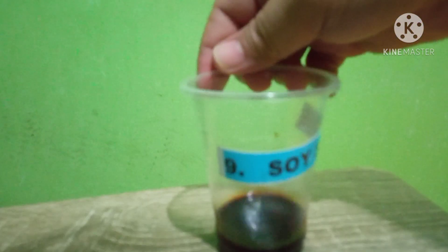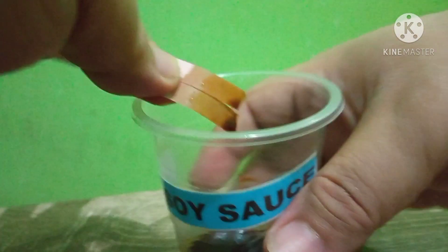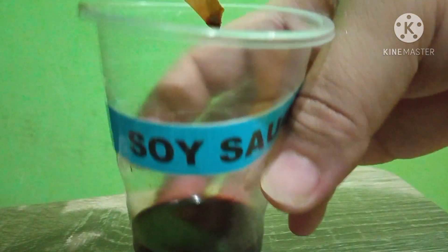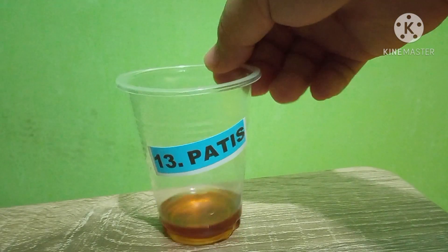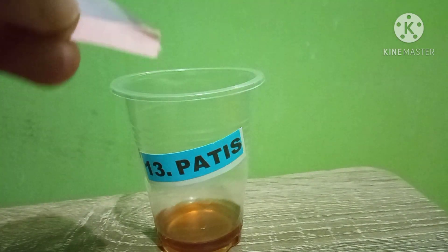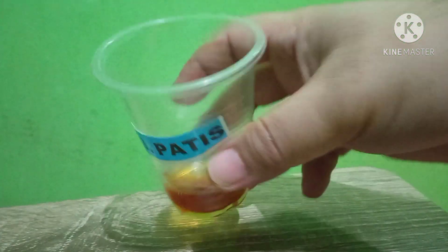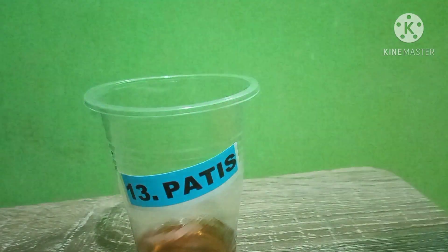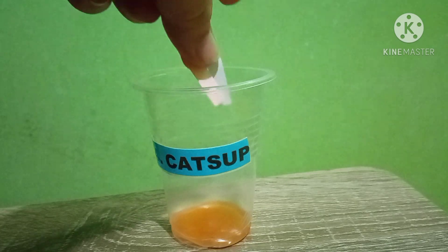Next is Soy Sauce. Let's dip them in — both turned red. Soy sauce is an acid. Next is Patis (fish sauce). Let's dip in the litmus papers — the blue one turned red. So patis is also an acid.